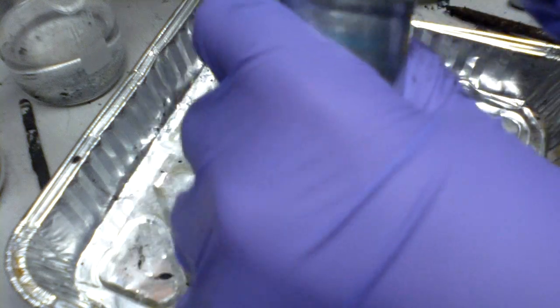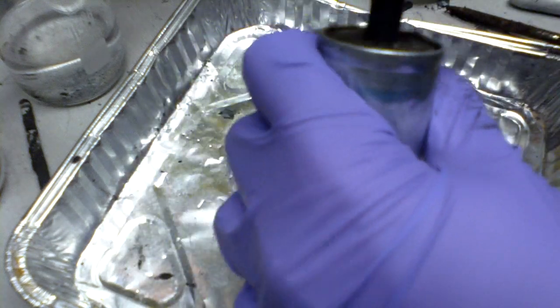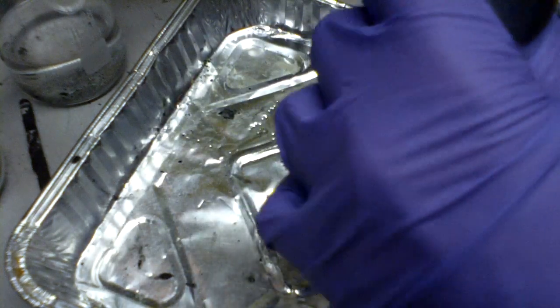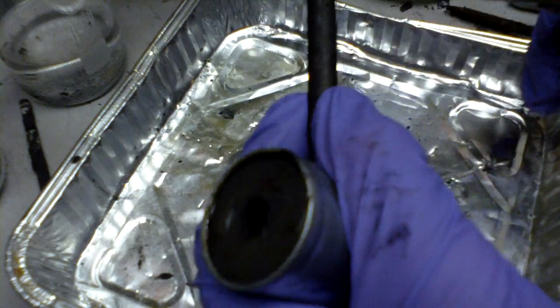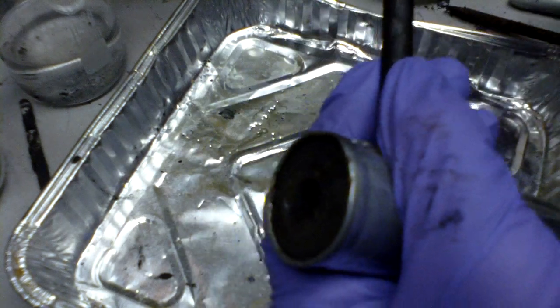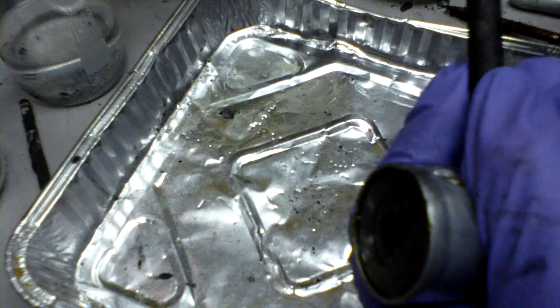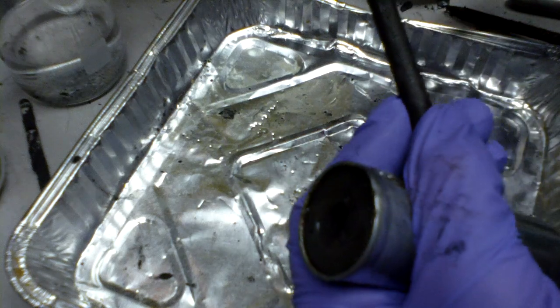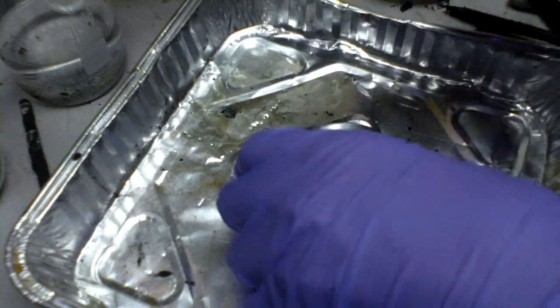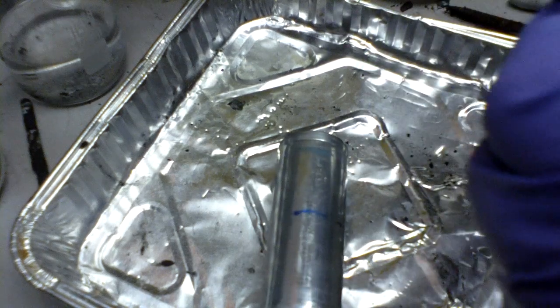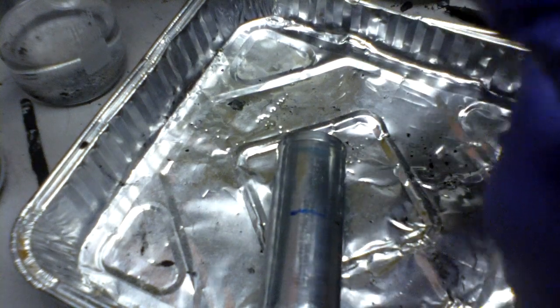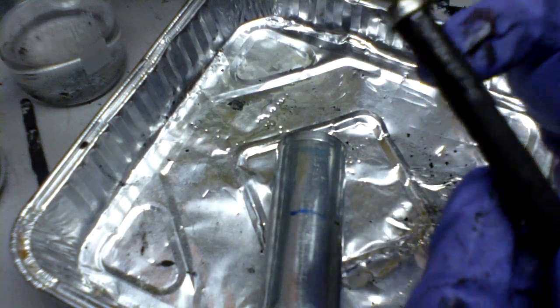And then there's your carbon electrode. The metal cap comes off very easily if you have the right pairs of pliers for doing this, which I don't. So I'll do that later.